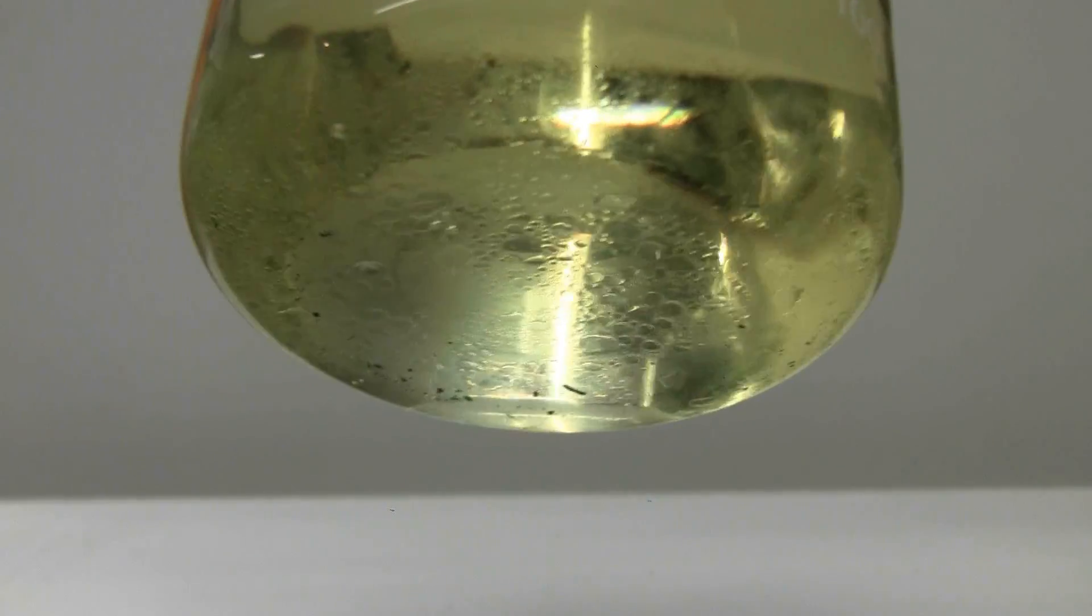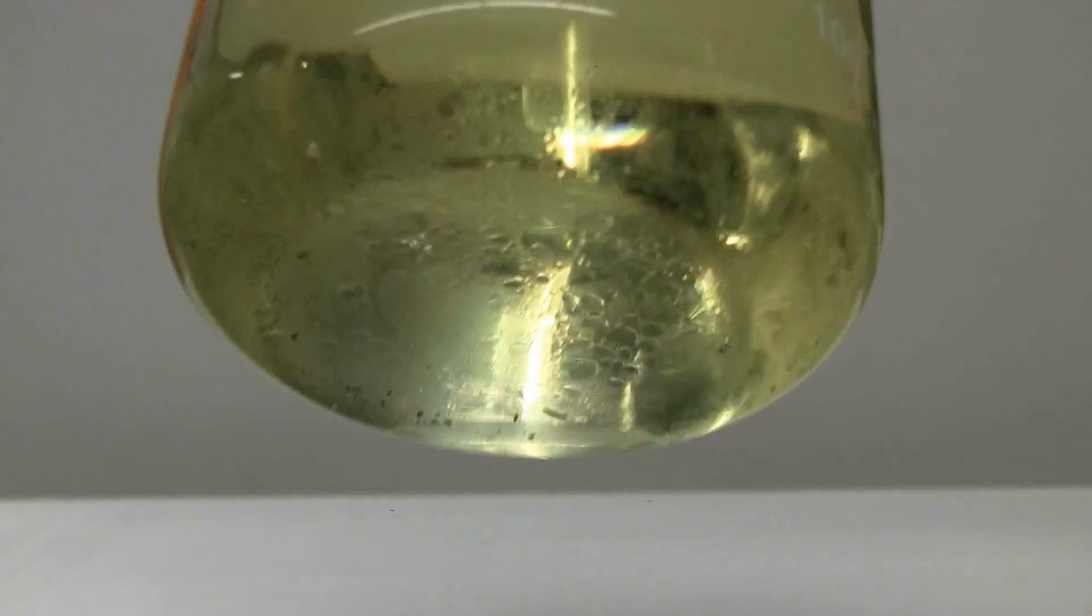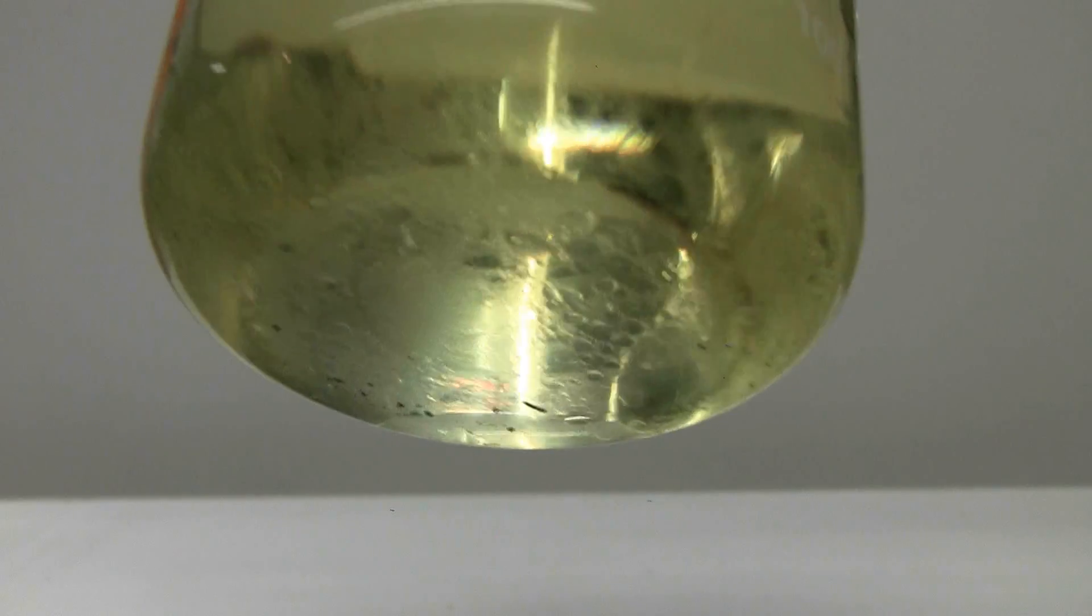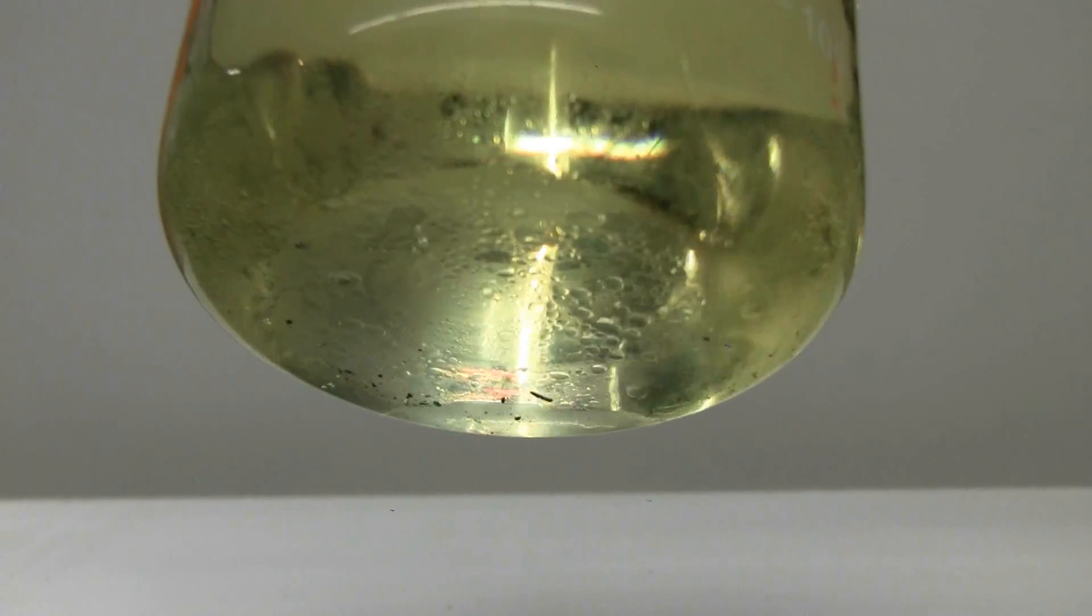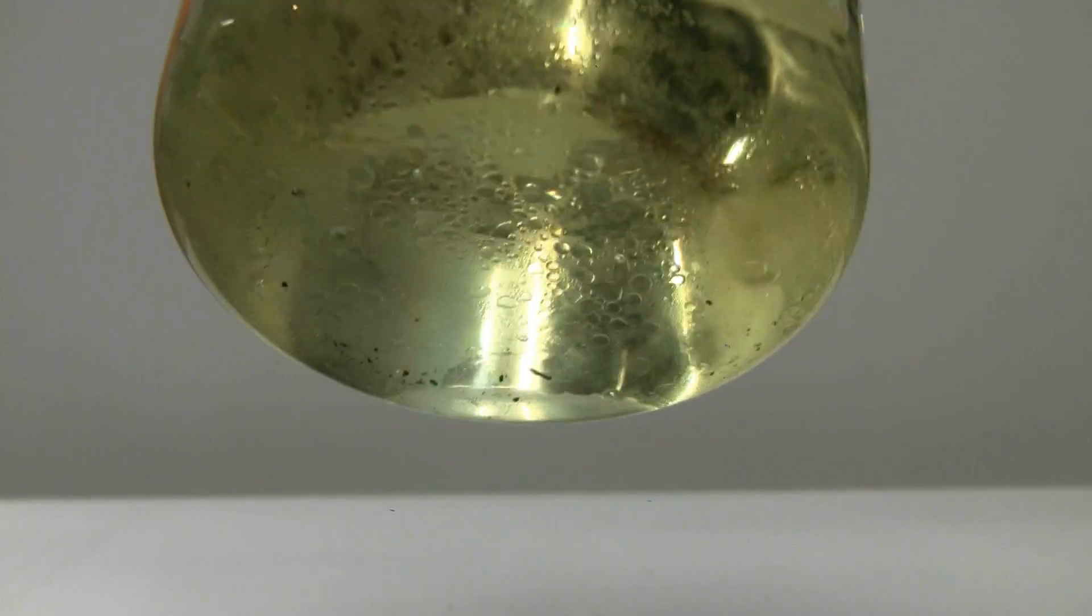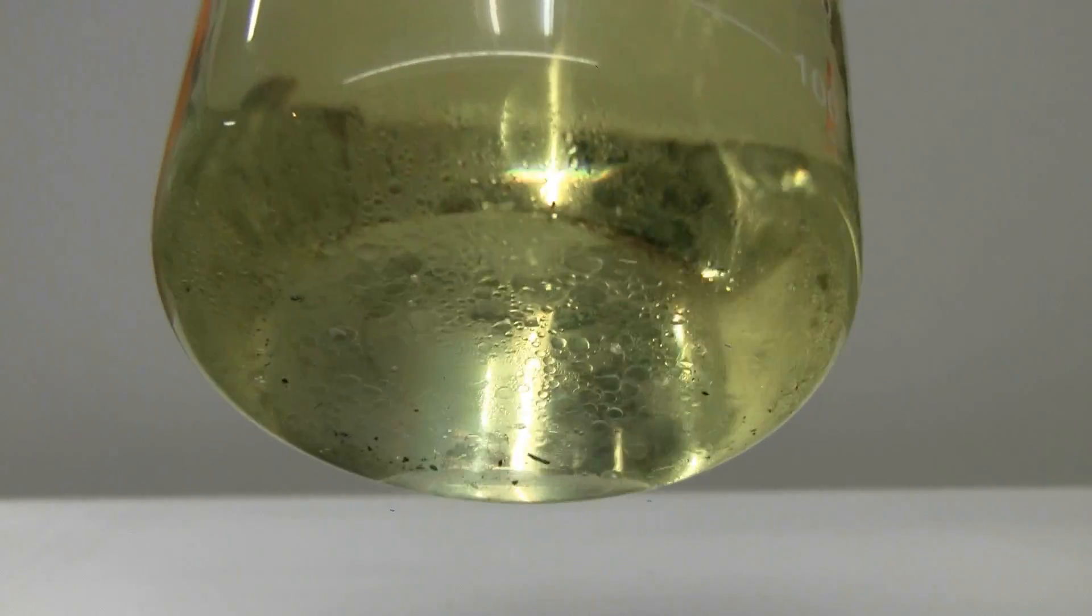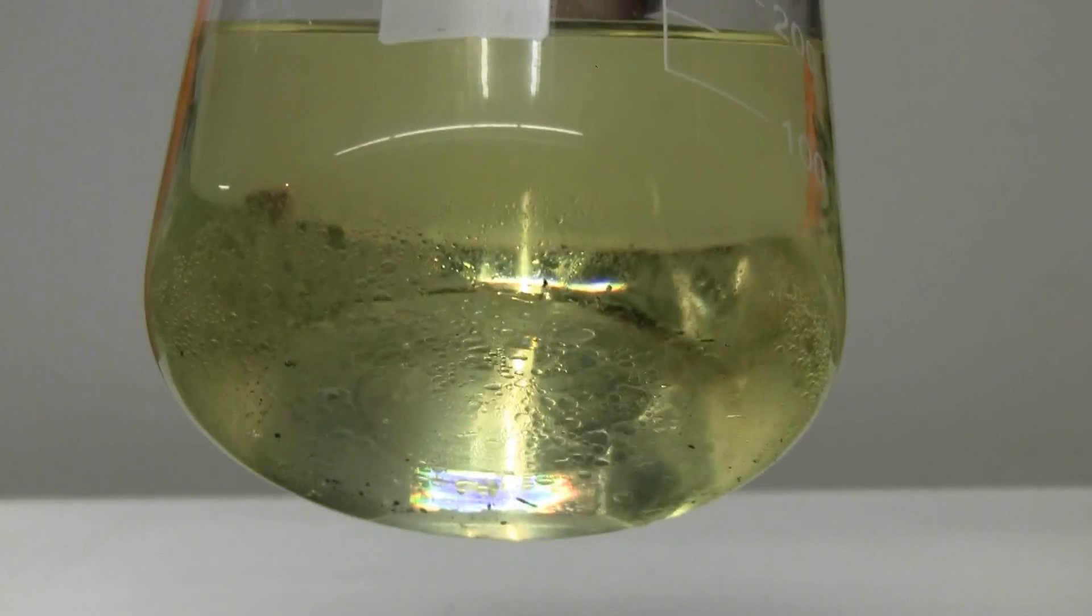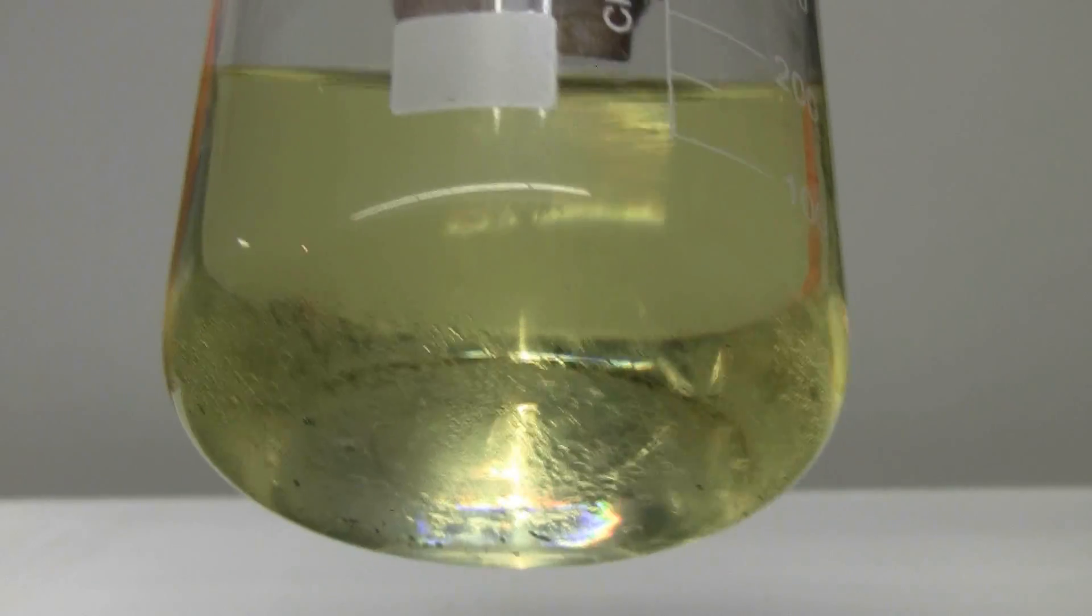About an hour ago I did the reaction properly, the way it's supposed to be done, drop wise with a sep funnel in another beaker and here I'm showing the bottom. We can sort of see the little droplets of chloroform that have separated out and are at the bottom waiting to be collected.